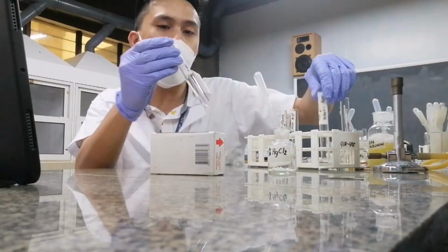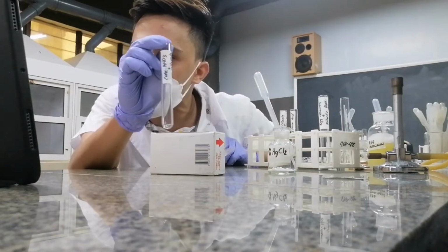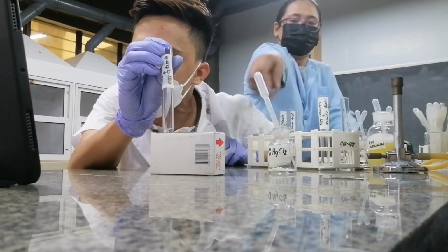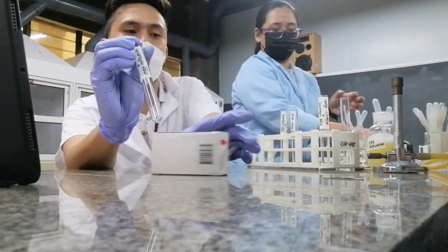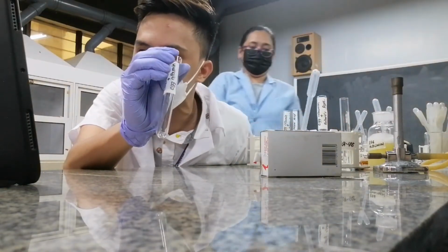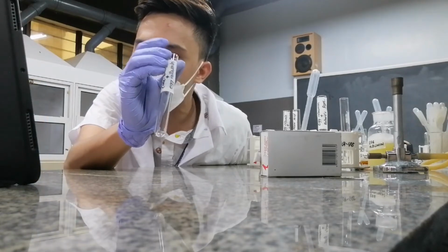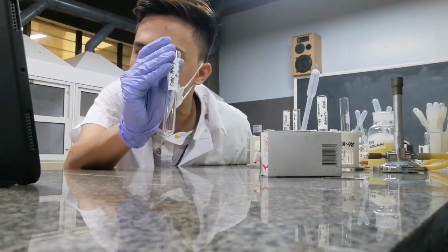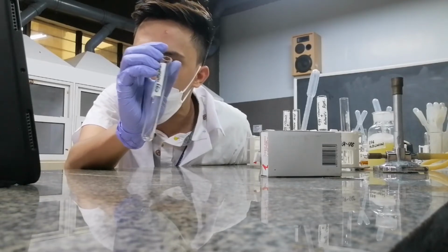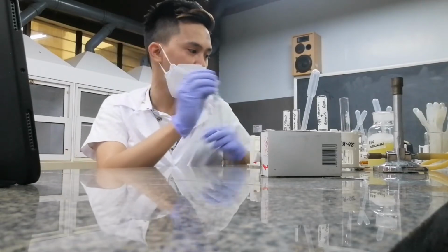Okay? So for strong mineral acids, first we will use your concentrated nitric acid. What do you call the test that uses strong mineral acid such as nitric acid? What test utilizes nitric acid? The one that forms a white ring. It was in the video, right? So you have your Heller's test, the white ring test, okay?